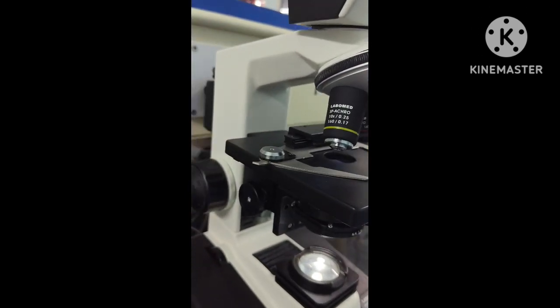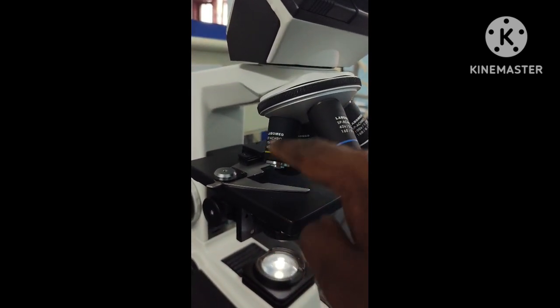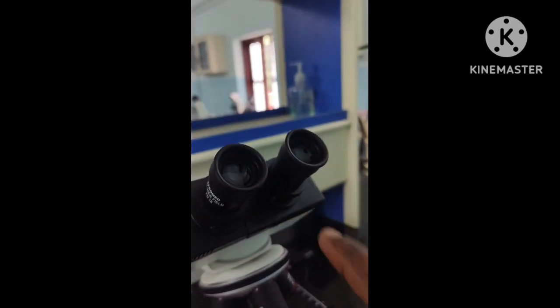And now, towards the last part of understanding the concept of microscope operation. We have the low power. When you are viewing through the low power, when the click sound is heard, it is in alignment with your eyes. You can view through the eyepiece, and what you find inside may be an unfocused area. Now you need to learn how to focus through the microscope.